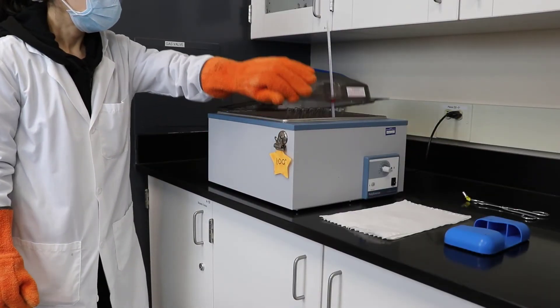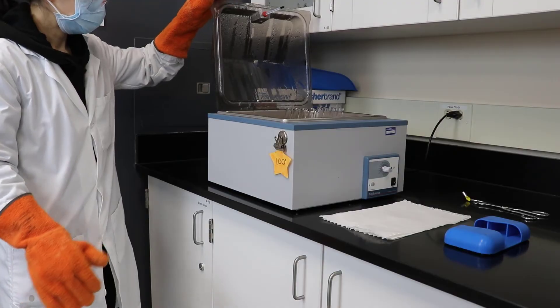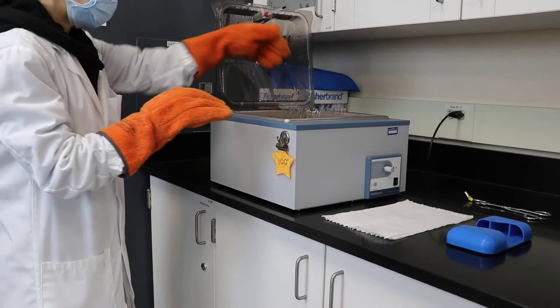After 3 minutes, pull the rack out of the water bath and set aside to cool for several minutes.